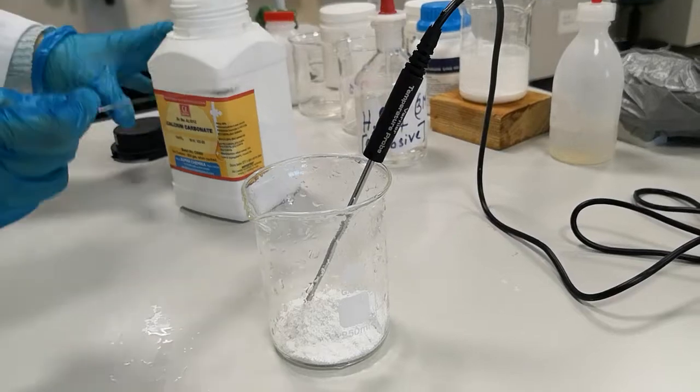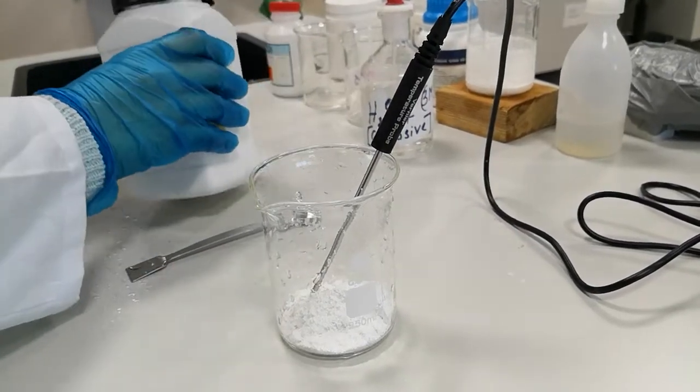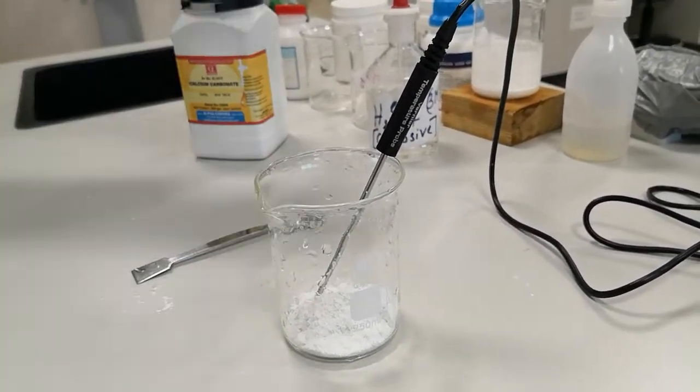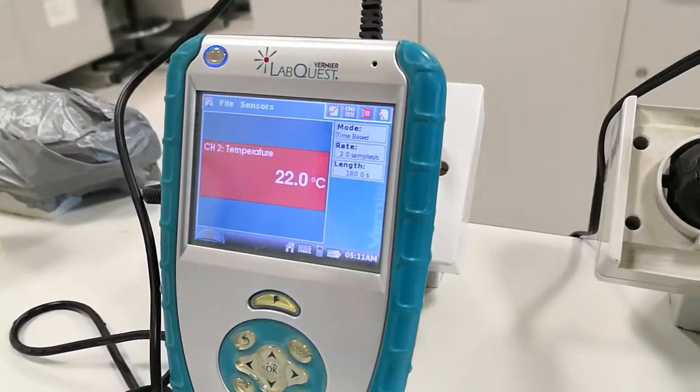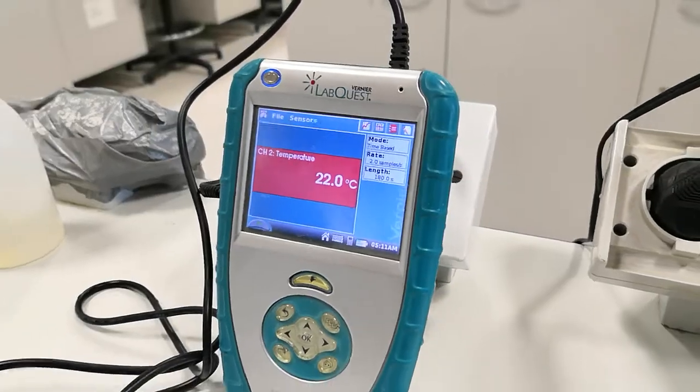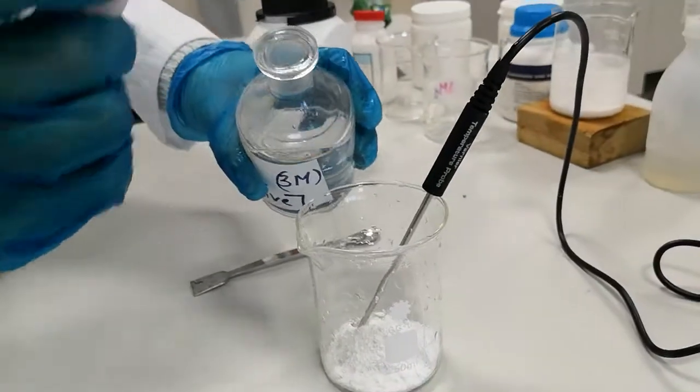So first we're recording the temperature. It is 22 degrees Celsius. Now you're gonna hear the sound of the bubbles of gas forming.